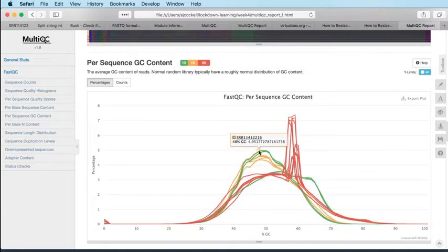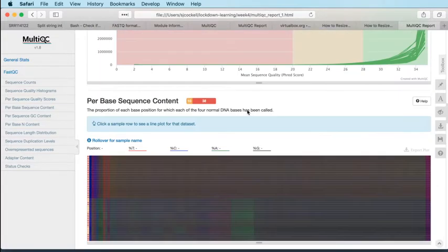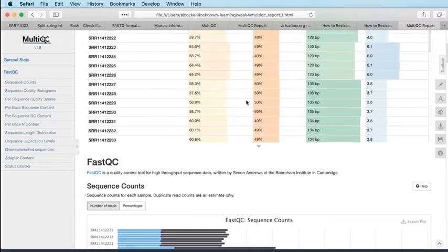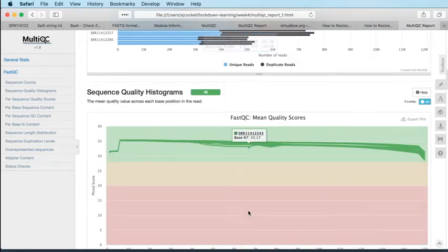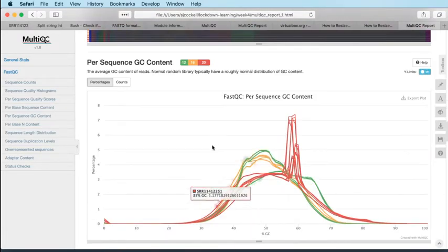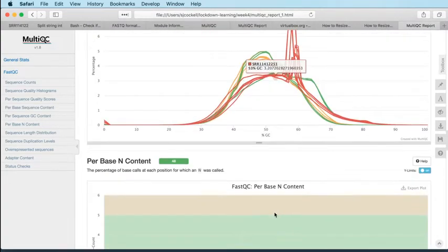Okay, so real change between, and again, I suspect this is between batch 1 and batch 2 of these experiments. So I'm pretty sure that if we go back up here, this first half of the samples is one condition and the second half is the other condition. So I think we're seeing the effect of the different conditions in the QC here. So yes, again, nothing too dramatic going on here.